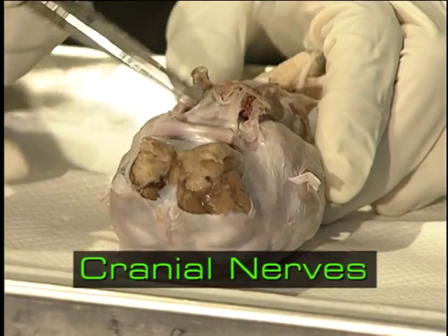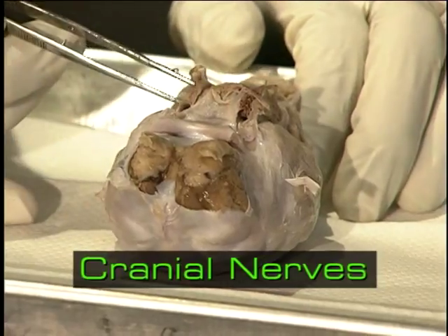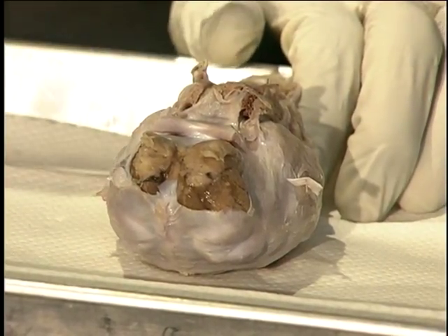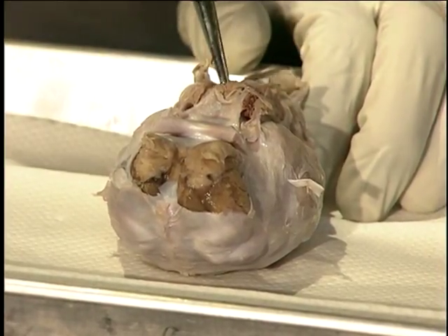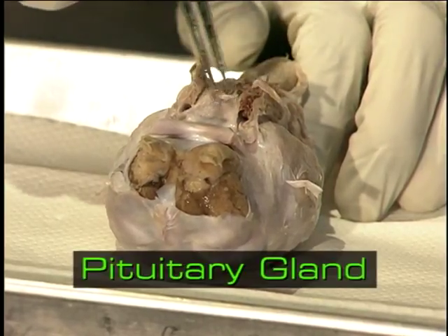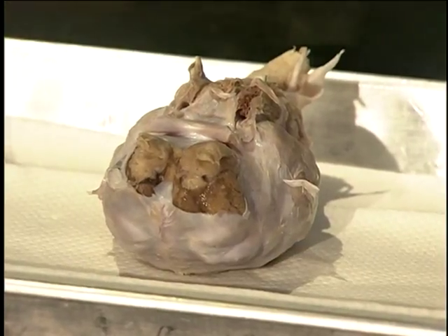The 12 cranial nerves are the first 12 nerves that branch off of the brain and spinal cord. And as we move further back along the brain, they begin to get increasingly smaller, so they're somewhat difficult to identify. But one area that we can point out is located here in the center of the brain, and this is called the Pituitary Gland.